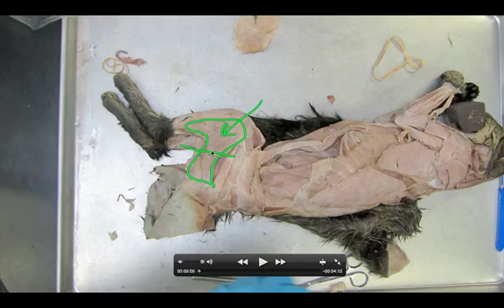Before we do so, we have two things that we need to find underneath it: the sciatic nerve and the tenuissimus. This is a very straightforward dissection. A huge deduction if you end up cutting the caudal femoralis — this muscle here should stay intact. It should actually be a pretty brief dissection video. So let's get this thing started.